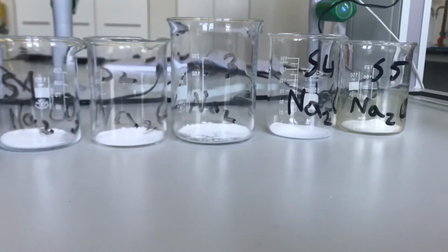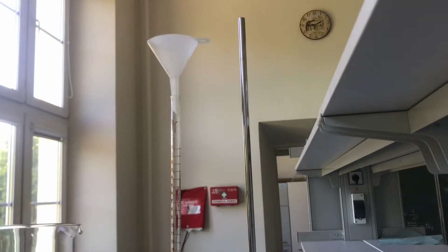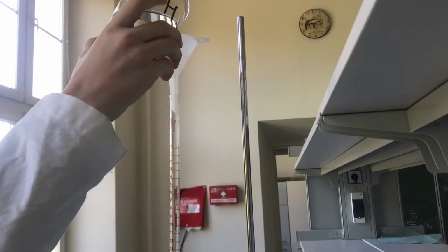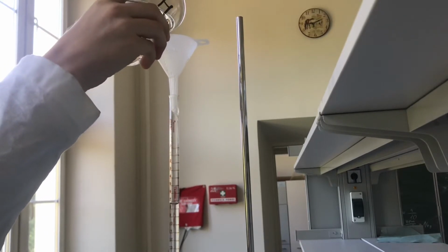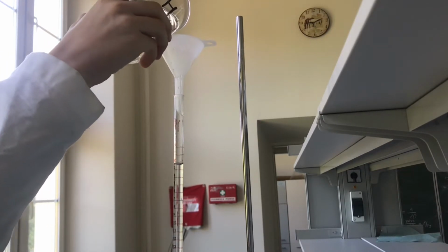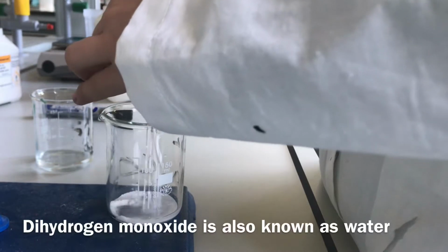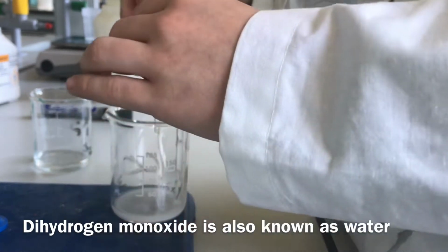I'm doing 3 different salts and 5 probes for each salt. After that, I proceed to pour distilled water into a vessel made for measuring fluid and fill it up to 50 milliliters. Then, slowly, drop by drop, I pour the dihydrogen monoxide in, whilst mixing it with the salt.